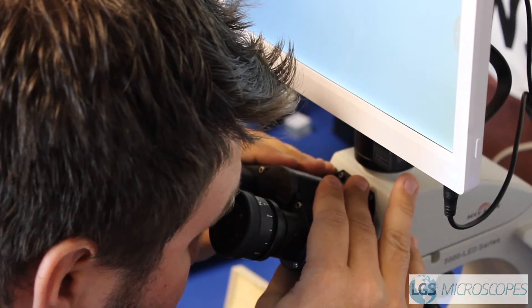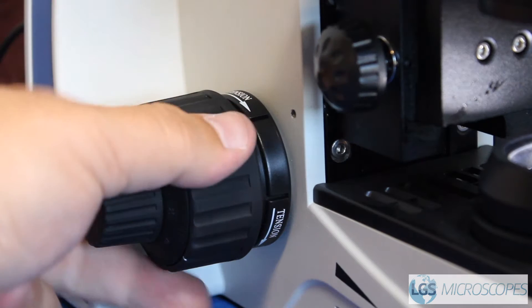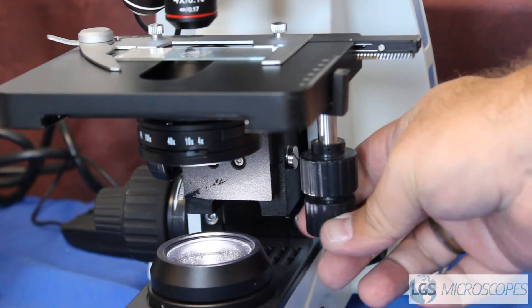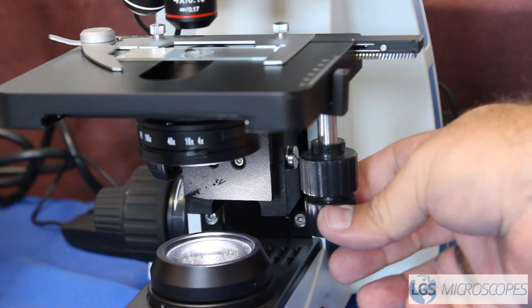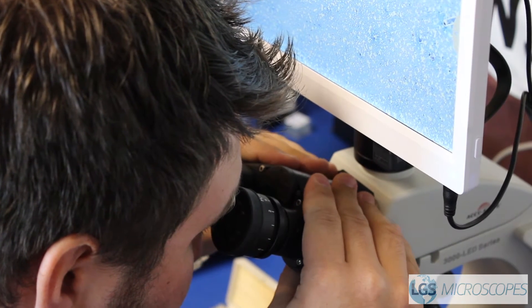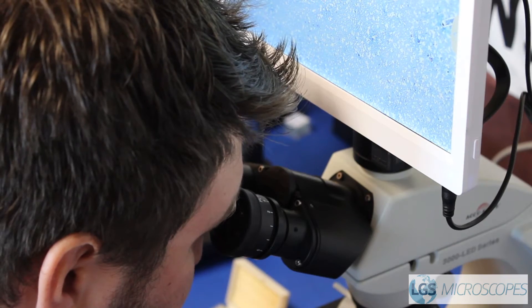So go ahead and get close. The stage is all the way down right now, so we need to raise it up using the coarse focus until you see your image come into focus. And there it is. Now you want to go ahead and start getting centered using your X and Y adjustments on the mechanical stage and find whatever it is that you're looking for. You can also use this time to adjust the interpupillary adjustment and make sure that both images are lining up properly.